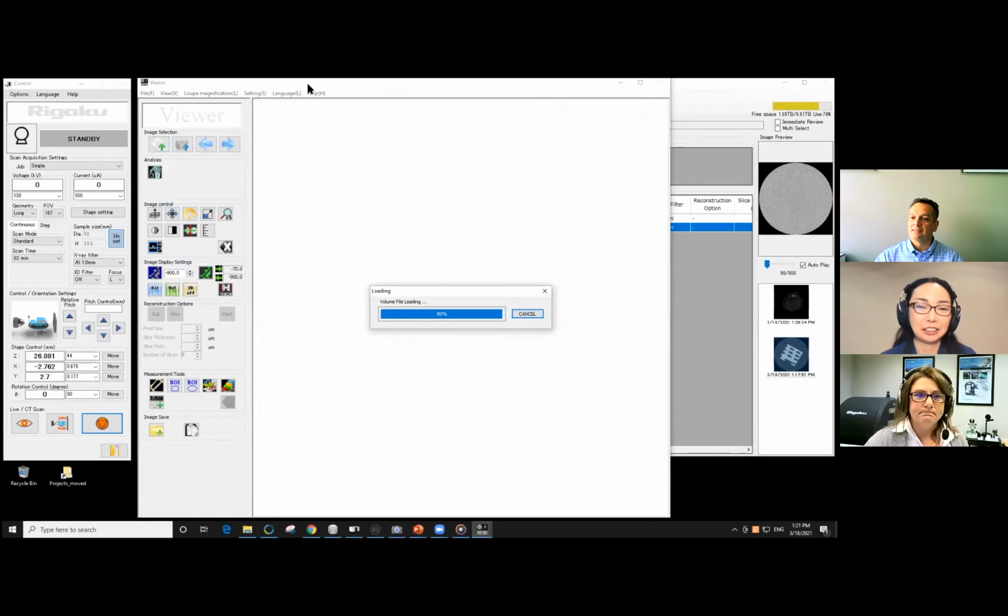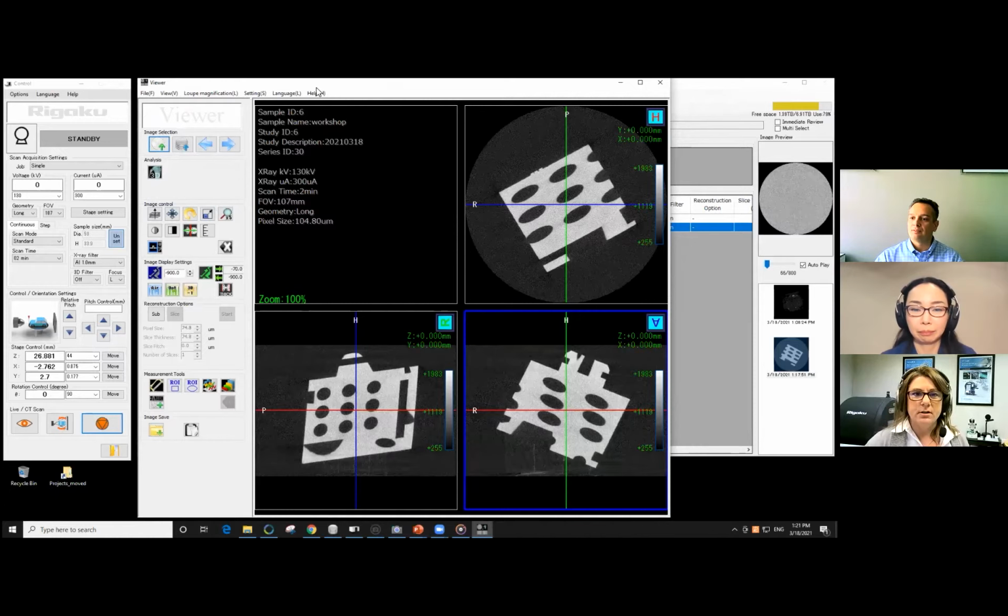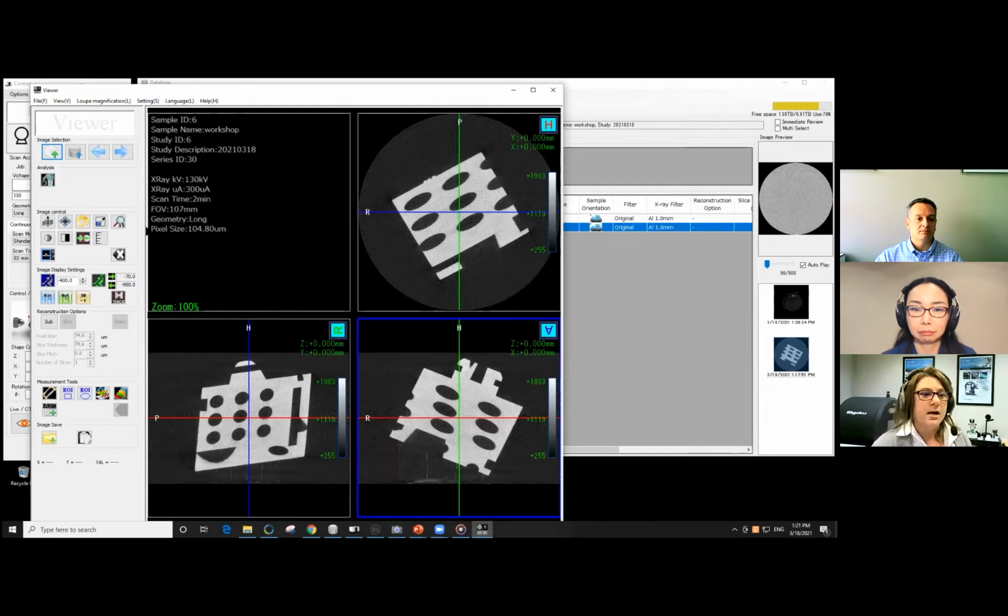So, all right, here's our image. Oh my goodness, it's a mess. It doesn't look like a block, but that's just because of the orientation we used in this case, right?